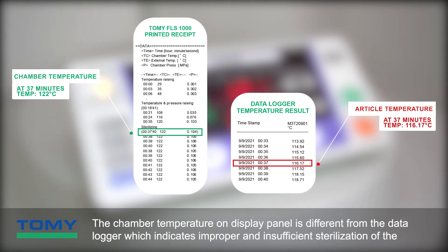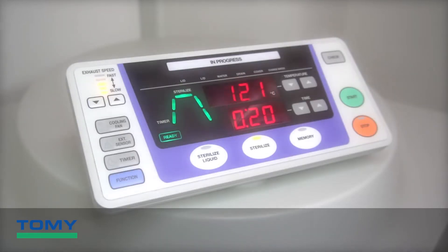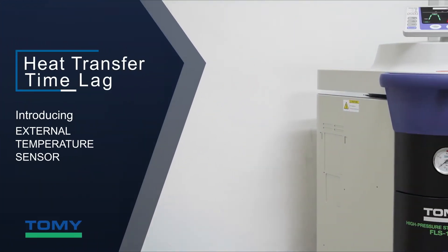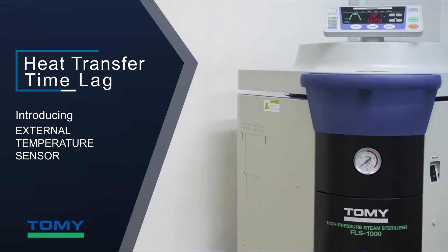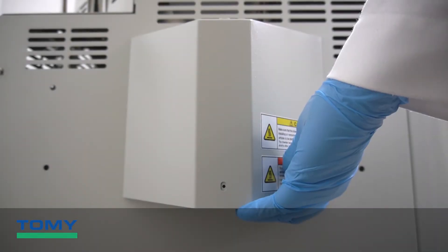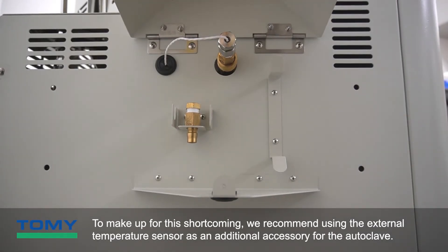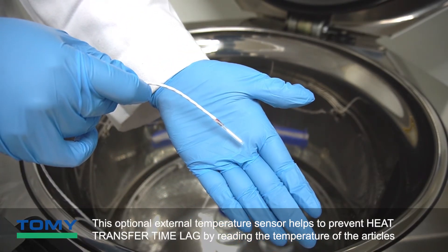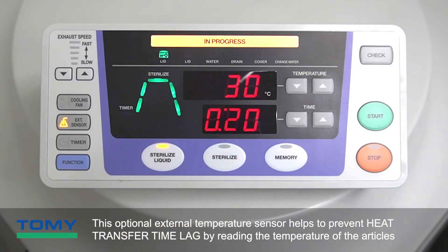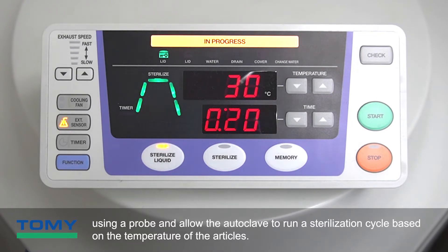The chamber temperature on the display panel differs from the article temperature. To address this shortcoming, we recommend using an external temperature sensor as an additional accessory for the autoclave. This optional external temperature sensor helps prevent heat transfer time lag by reading the temperature of the article using a probe, allowing the autoclave to run a sterilization cycle based on the actual article temperature.